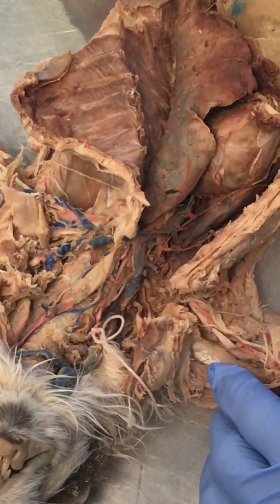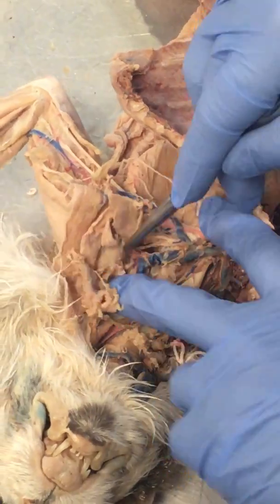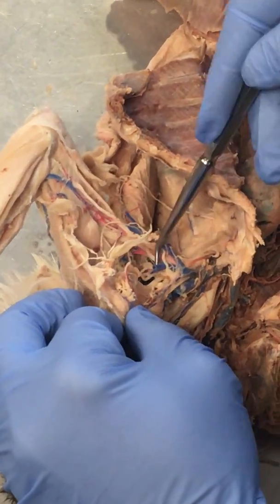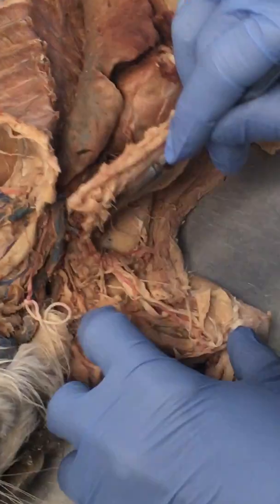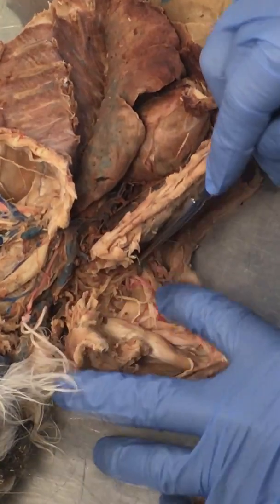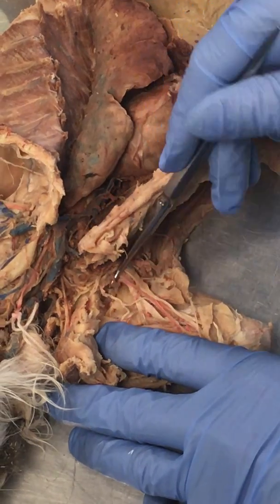So, subscapular. Sometimes we'll find a good subscapular. The other cat I was looking at on Tuesday had a really good one, went back into that subscapular region, and I'm seeing, looks like it's been torn here. That was it right there. See if we see it on the other side. All right, so there, this is where it usually goes. Well, here we go. So this is going to be subscapular artery, kind of this vessel right here, that artery right there.